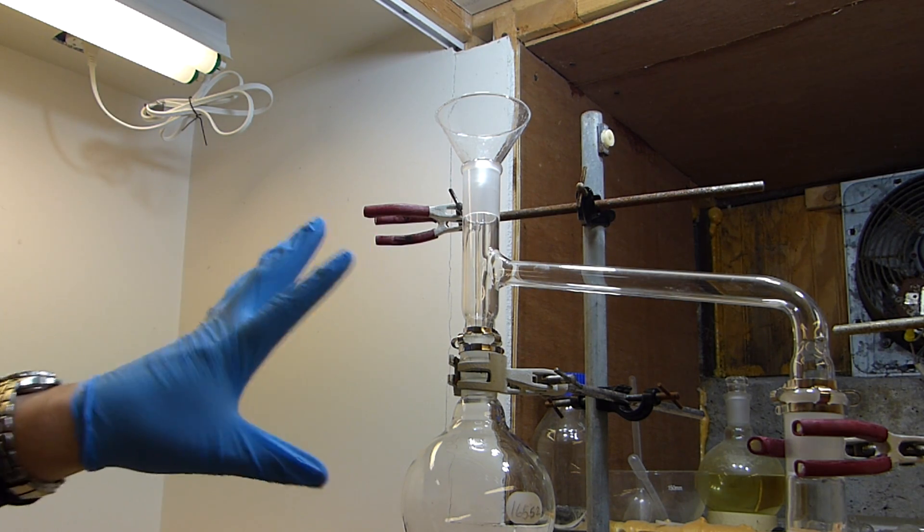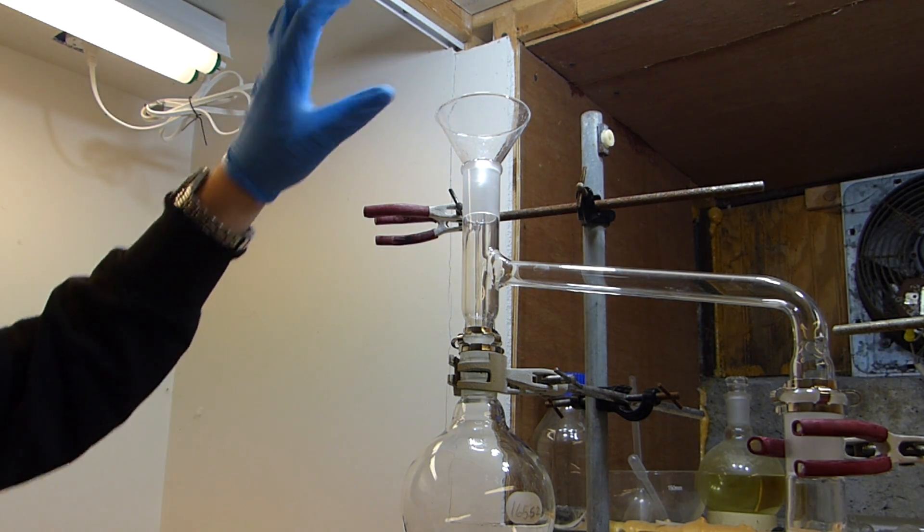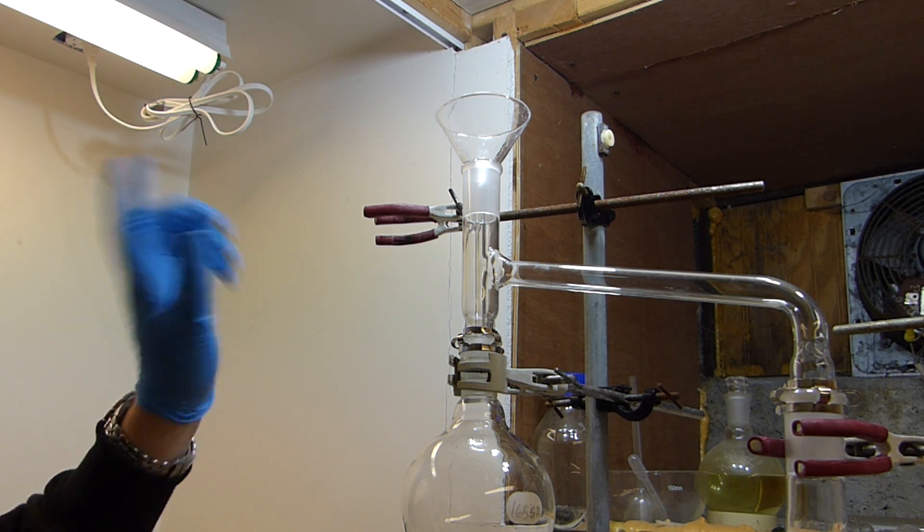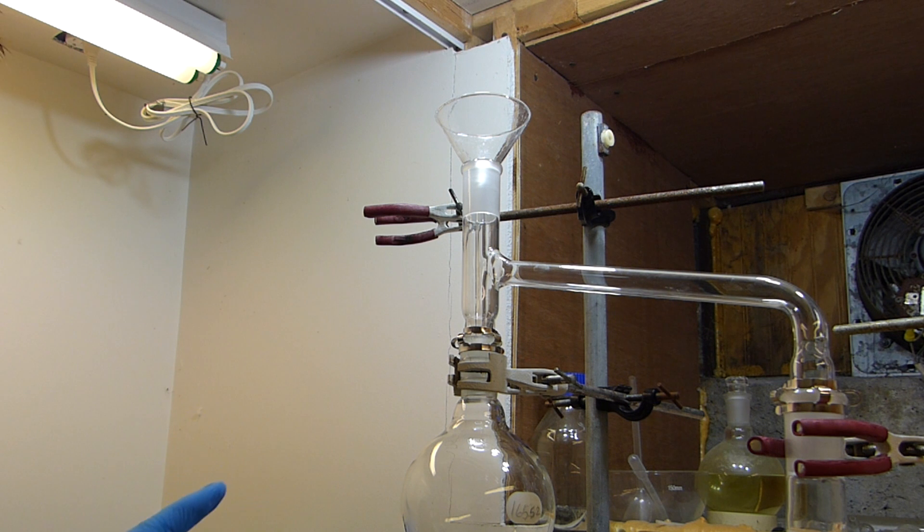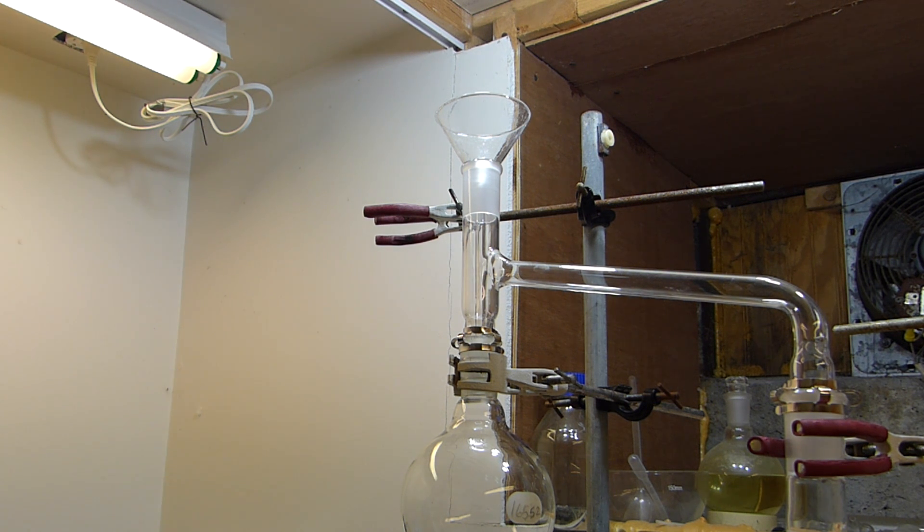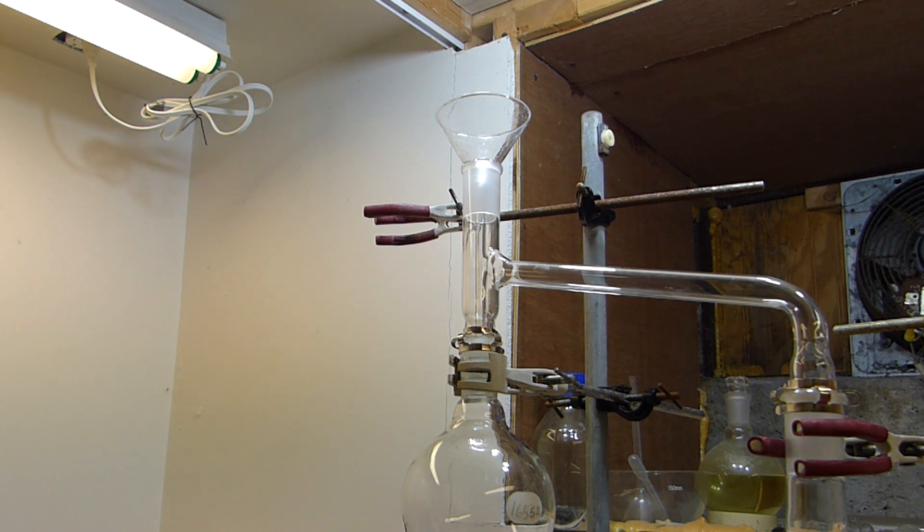What this allows me to do is that when the acid in this boiling pot runs low, I can allow the acid to cool down to below the boiling point of 92% sulfuric acid and then actually add more to cap it back up and then start it back up again. So this rig as set up, I could just continue to add more and more sulfuric acid, cycling the temperature and produce quite a lot of much cleaner sulfuric acid.